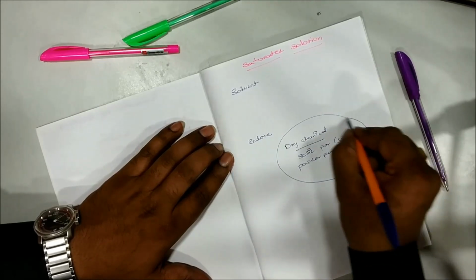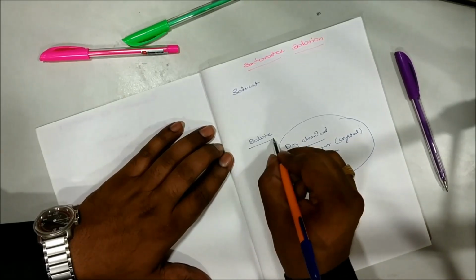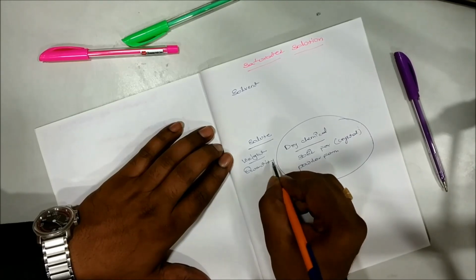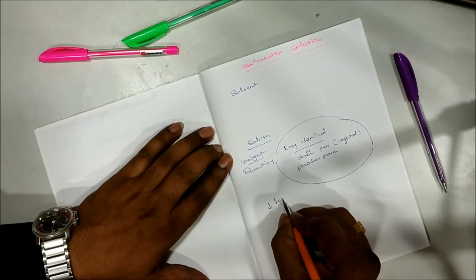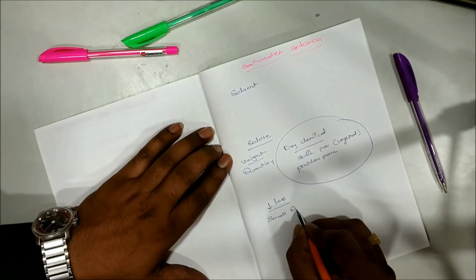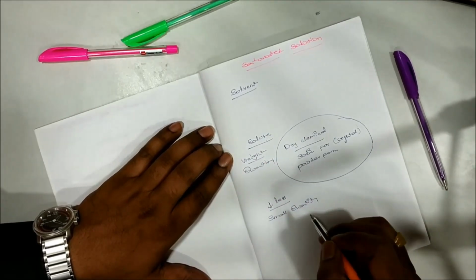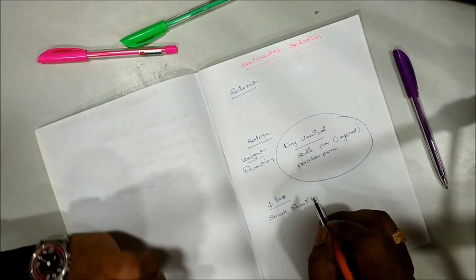Out of this, you also have to remember one more important thing, that is the weight of solute. The weight or quantity of the solute is always less. We will take only small quantity when compared with solvent. It will be always less in quantity when compared with the quantity of the solvent.